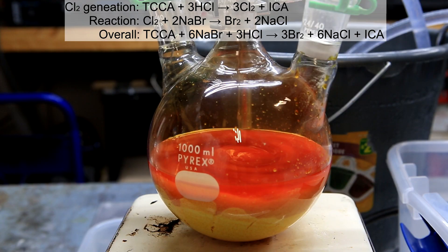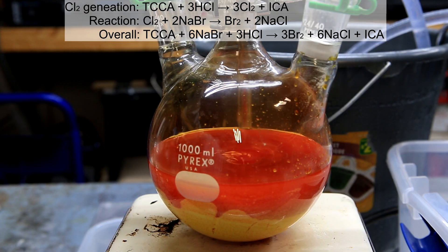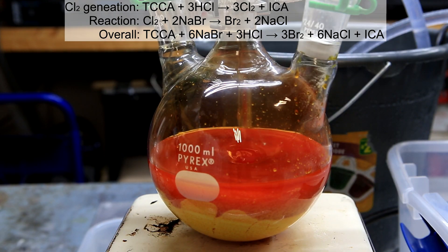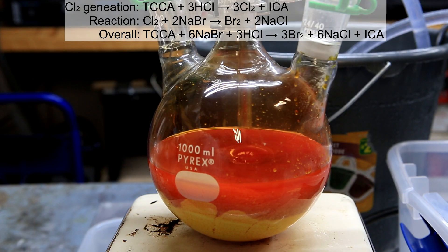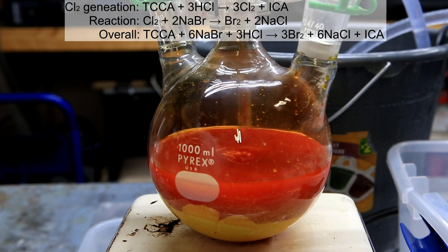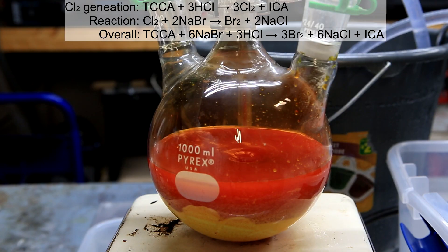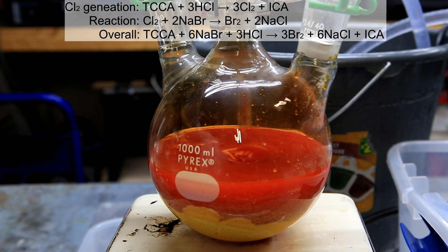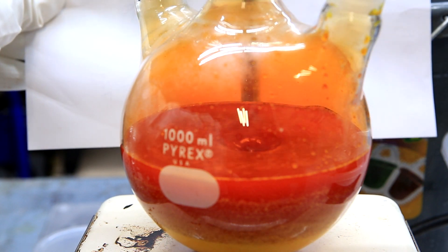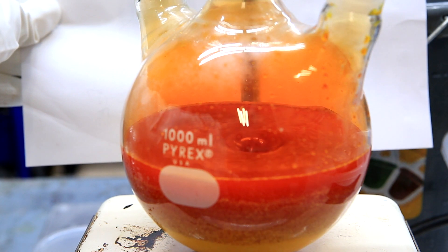When the HCl is added, it reacts with the TCCA to release chlorine. The chlorine then reacts with the sodium bromide to form sodium chloride and bromine. As more and more HCl is added, more bromine is produced, and the dark red color of bromine becomes much more evident. After all of the HCl is added, the solution is a very dark red with some fumes above it.